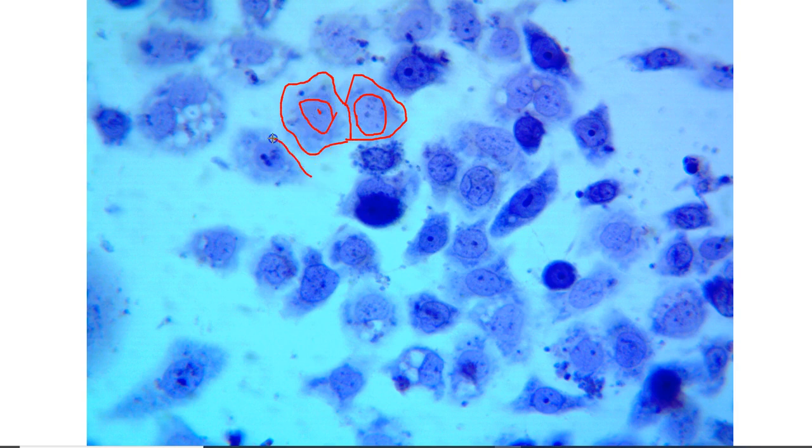So here would be a typical cell. You can look at this one and you see the nucleus and you see the nucleoli, and so this would be a typical cell. And then you have another typical-ish cell on this side, but then you have stalled cells, and this can be an interesting cell. It almost seemed like it had a mini nucleus inside as well. Here's another example of a stalled cell. So there are some very large nuclei inside.